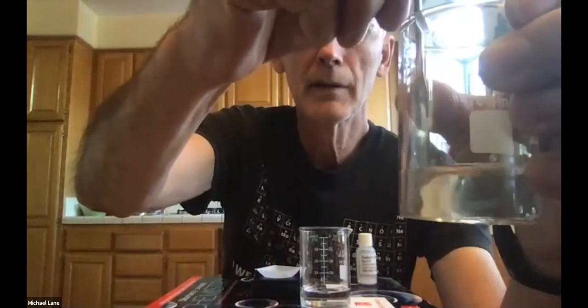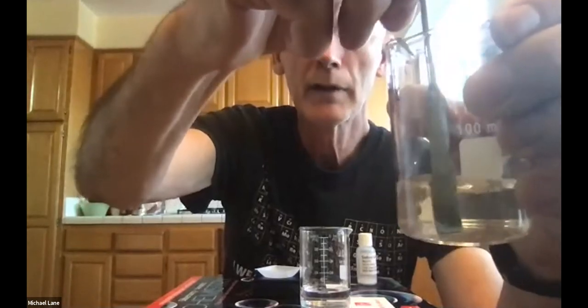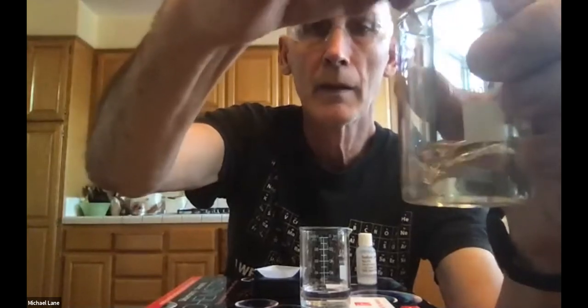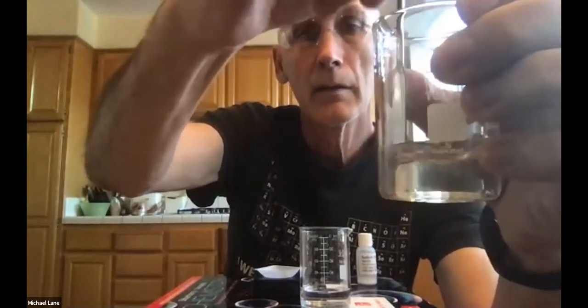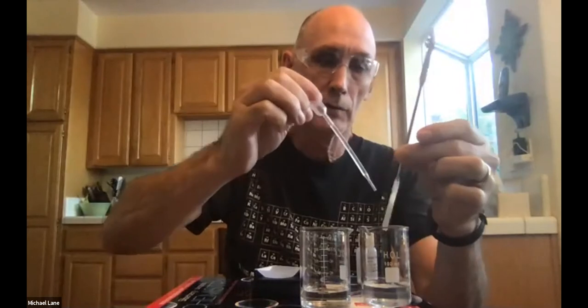So I'm gonna get down in there and you can't see it. I'm wanting to make certain this is completely dissolved, because of course, if it's not completely dissolved, it will not react completely. So there we go. And I've got a little bit of liquid hanging up here, and that liquid has some calcium chloride in it, excuse me. And I want to make certain that I rinse that off and get everything back into the solution so that this has nothing but distilled water on it. Okay, so that's set up.